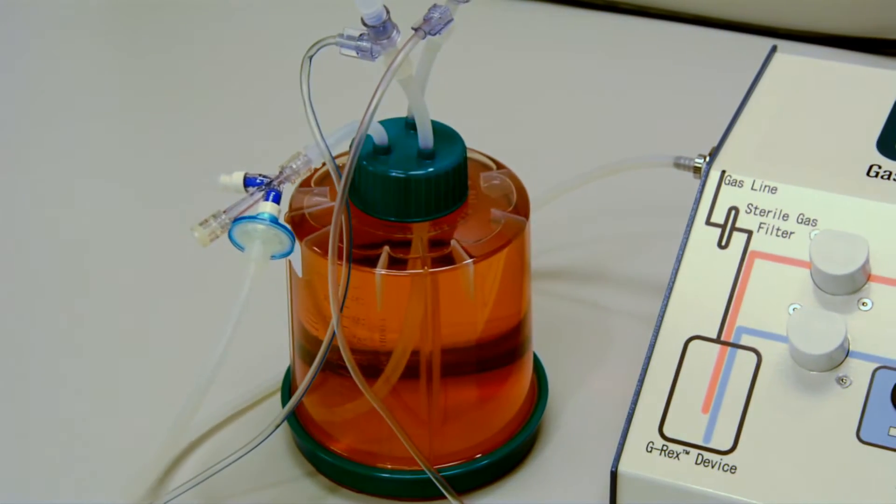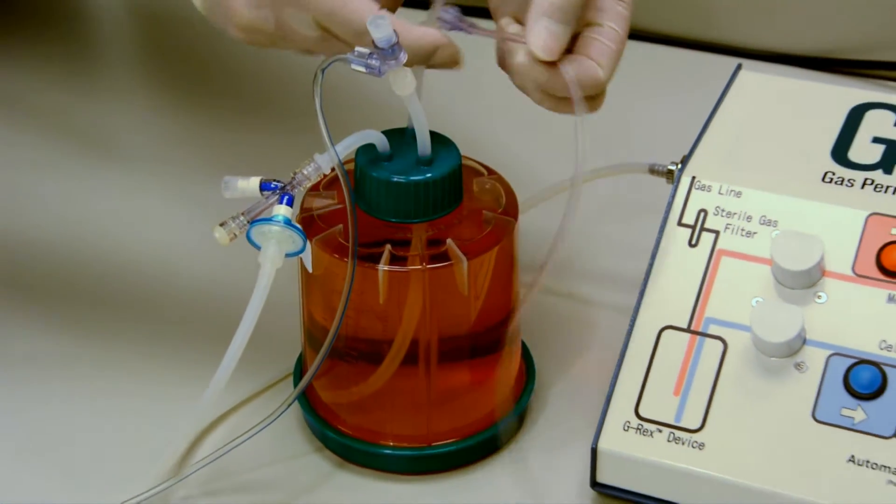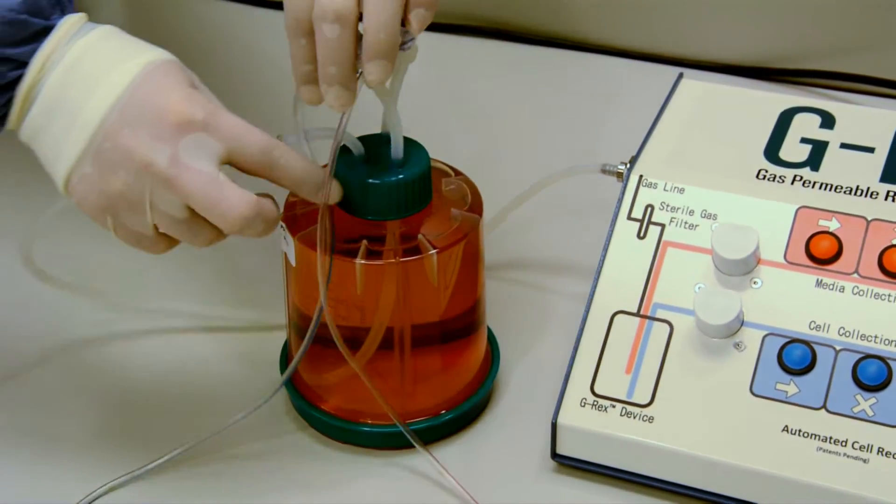Then, we identify our excess media collection line, orange, and the cell collection line, blue.